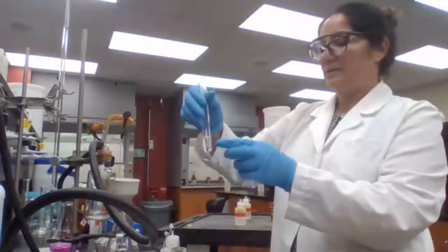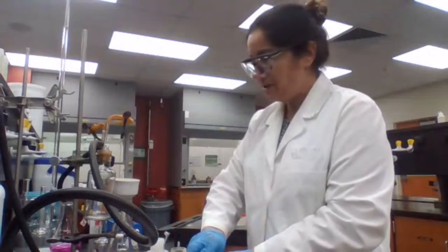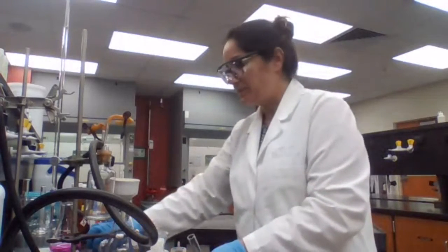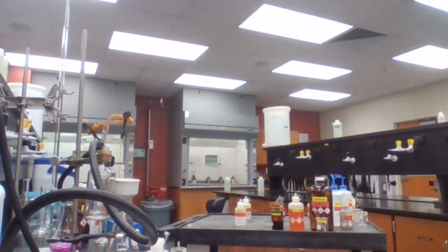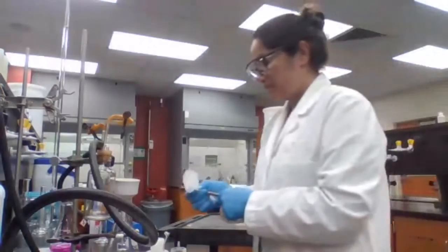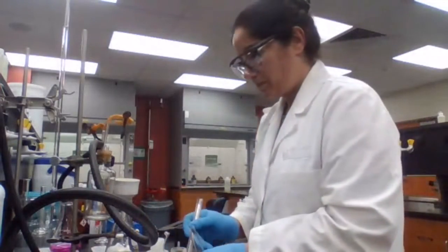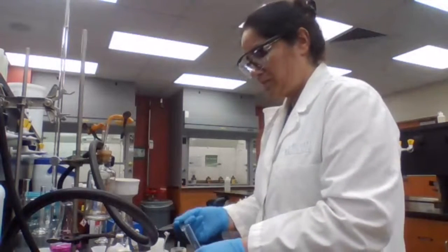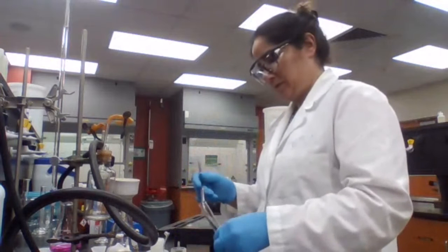So I have the Tollens reagent. I'm going to add my sample. Professor, are you doing the chromic acid test right now?